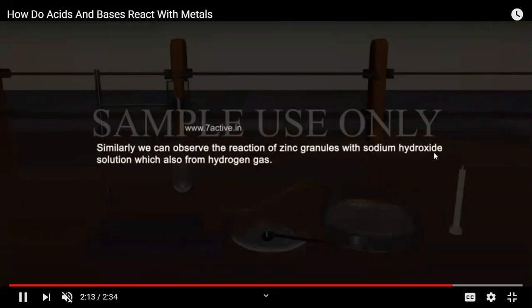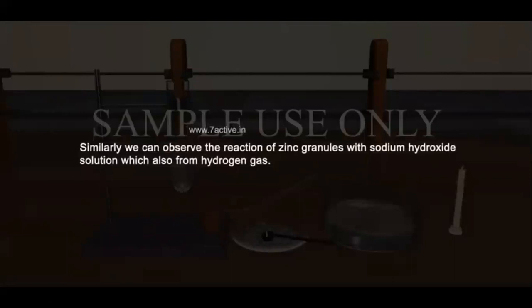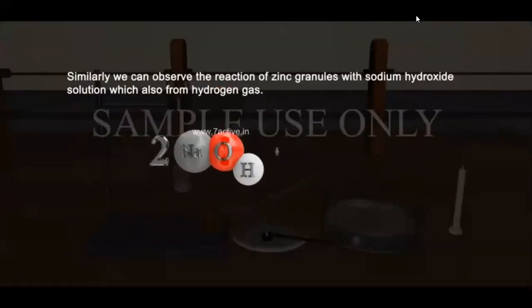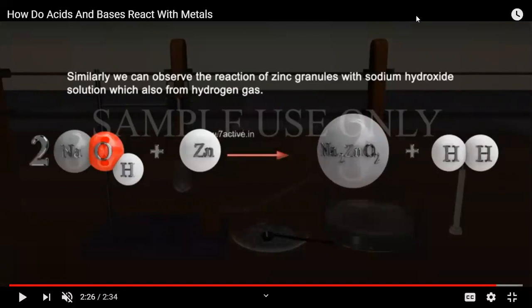So you can observe the reaction between zinc granules and sodium hydroxide solution. So we have taken NaOH plus zinc. NaOH is a base and zinc is a metal. Again, on the basis of the reactivity series, we can say that zinc can replace hydrogen because it is more reactive.